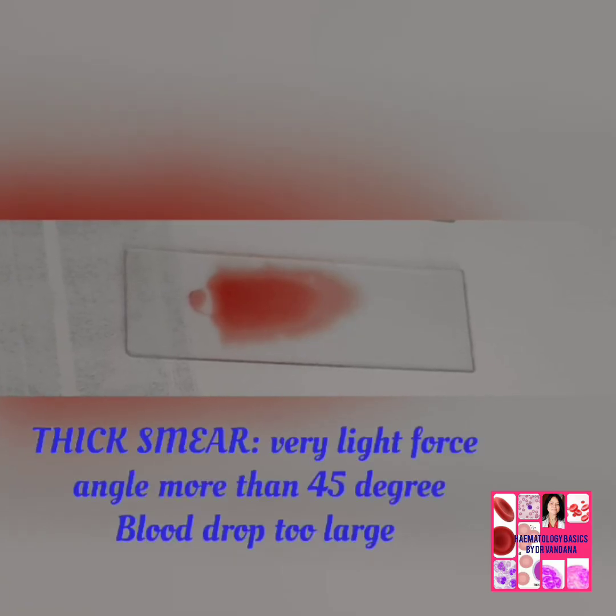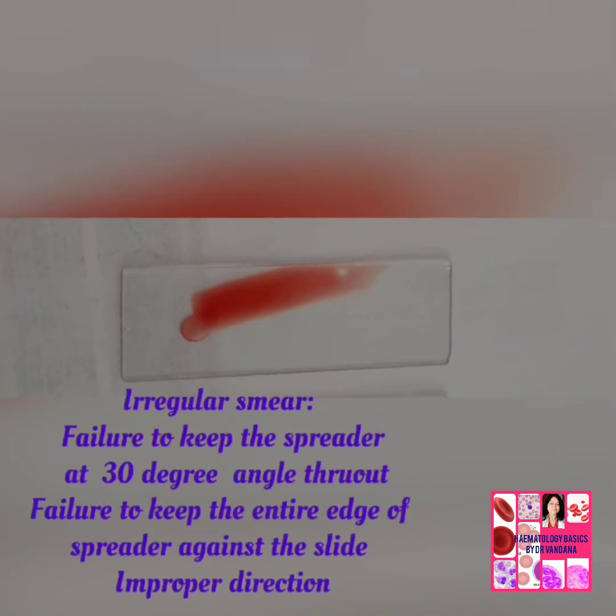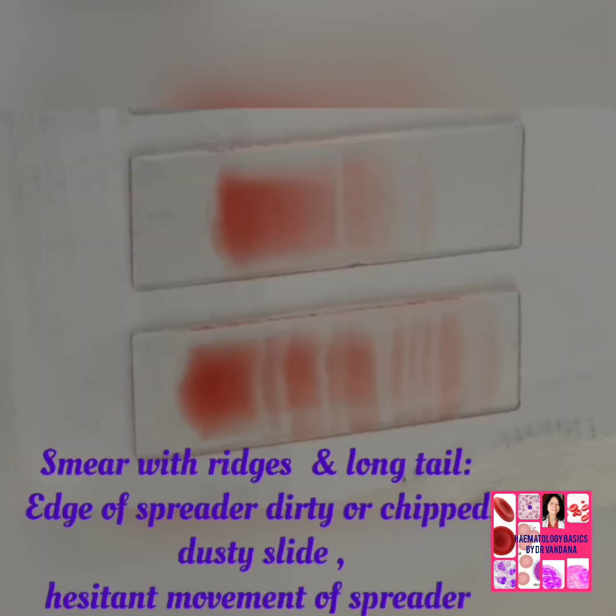Here is a thick smear where the angle is more than 45 degrees. Drop of blood was also big. And this is a too long thick smear, angle less than 30 degrees. Drop of blood too big. This is an irregular smear, improper direction, failure to keep the edge of the spreader against the slide.